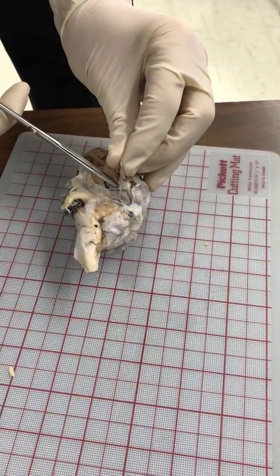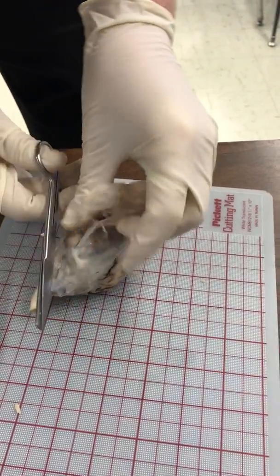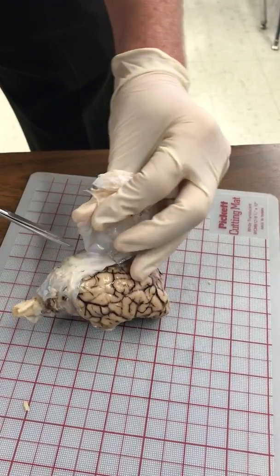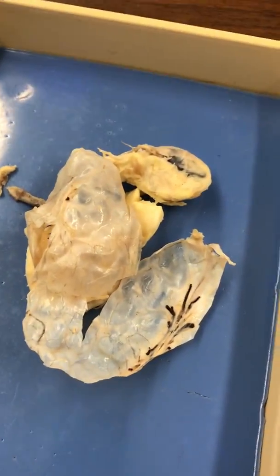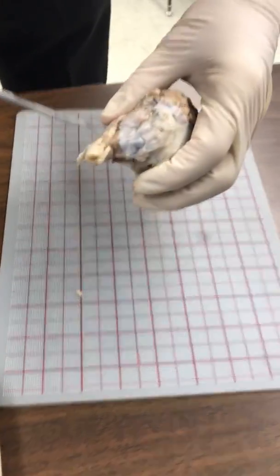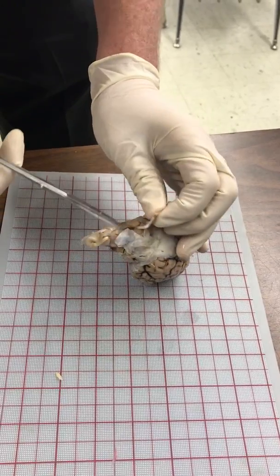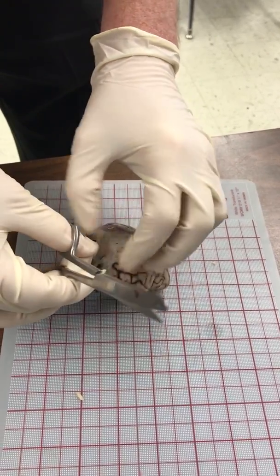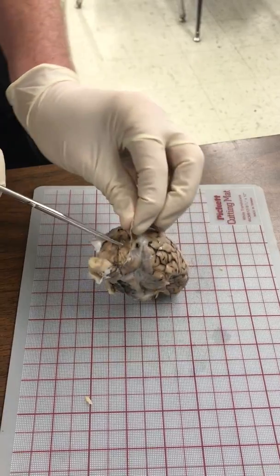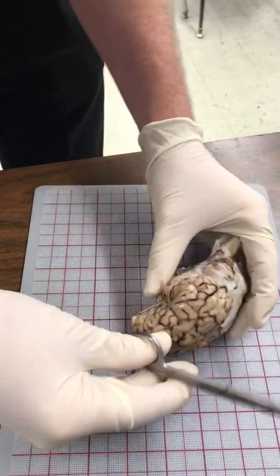There's a little brain damage there — the cortex got pushed in. That happens when they remove the brains from the sheep. I've got most of that top removed now. I'm going to come from the back and try to get a little bit more working space. I can see most of this has actually been torn off already — it was squished during shipping.